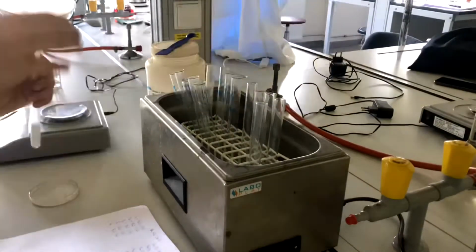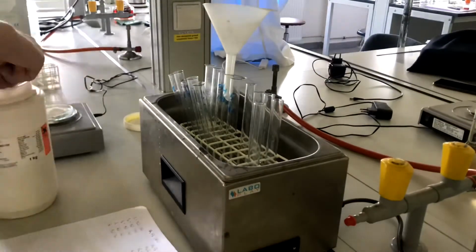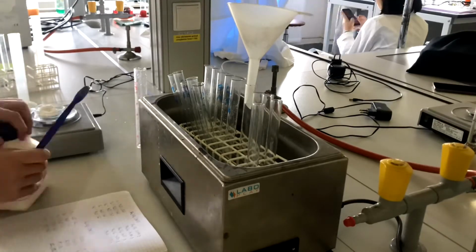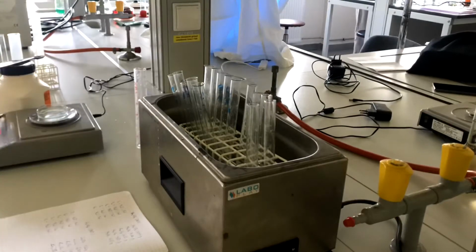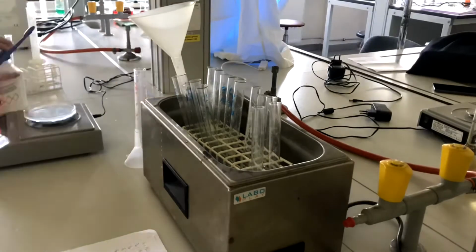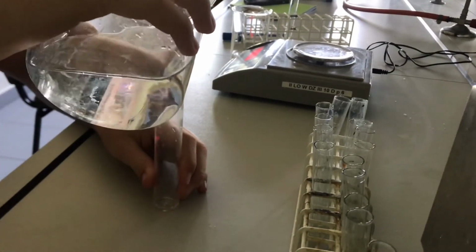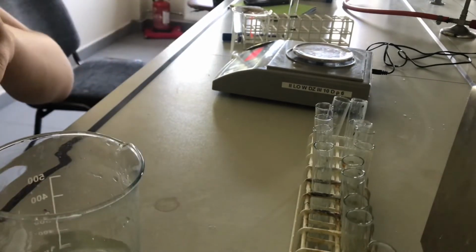When it was hot, I added salt to the utensils and took notes on how much salt I had added. After that, I measured 5 milliliters of water in 15 vessels, 1 water vessel for 1 salt vessel.